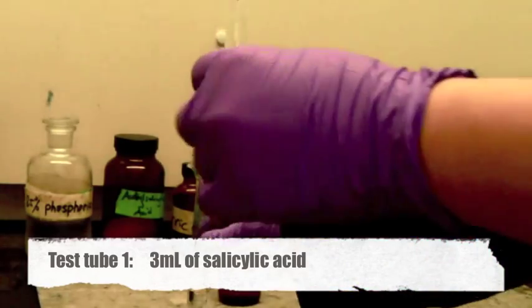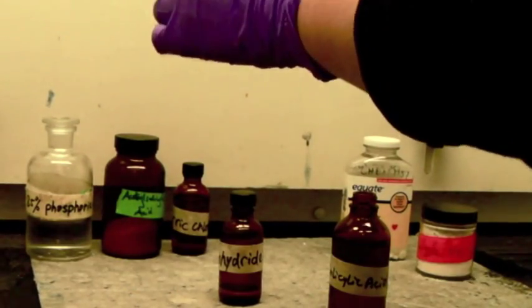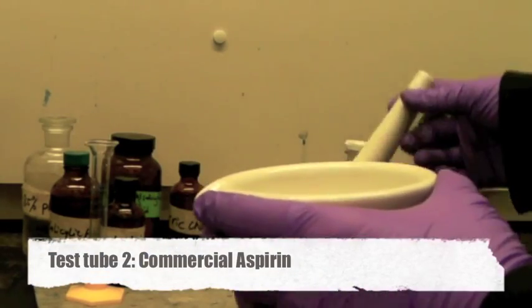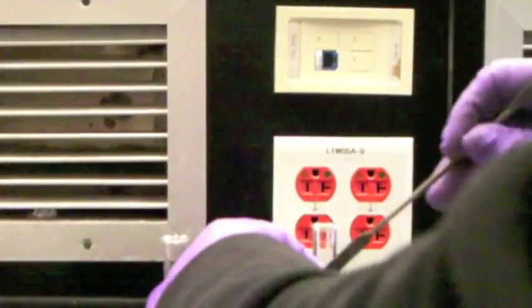Measure 3 ml of salicylic acid and place it in test tube 1. Crush an aspirin and dissolve it with 3 ml of water in test tube 2. Half an aspirin is enough for this.